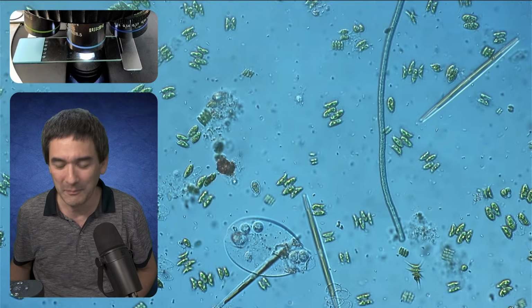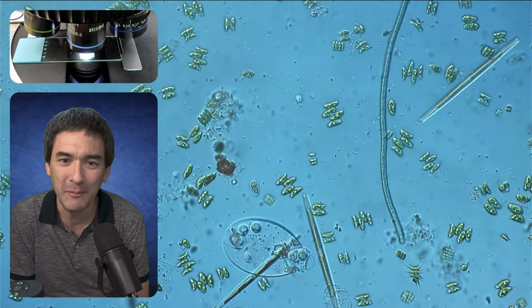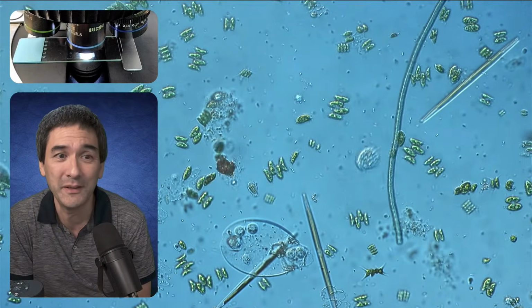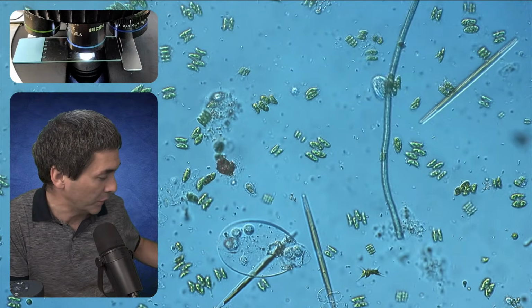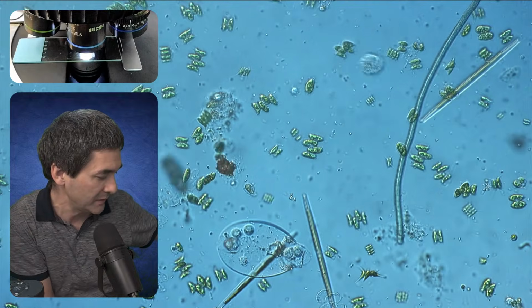So today I want to do something very traditional again. I want to look at a couple of water samples, a couple of algae again. I know that this is something that I've been doing every now and then. I collected 4 water samples today to look at. I did not look at all of them yet.